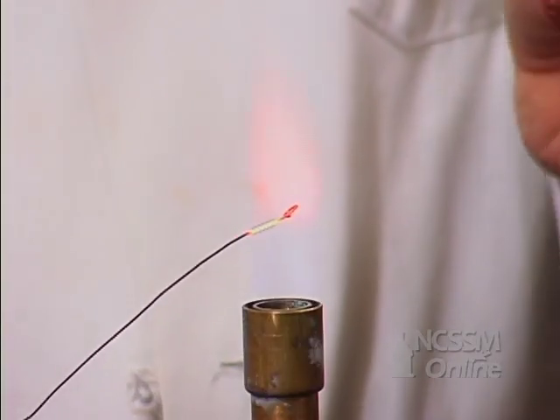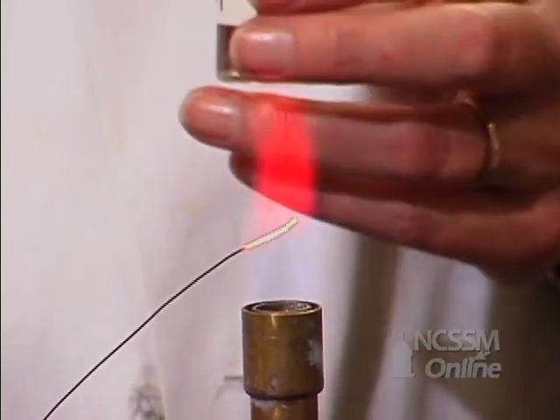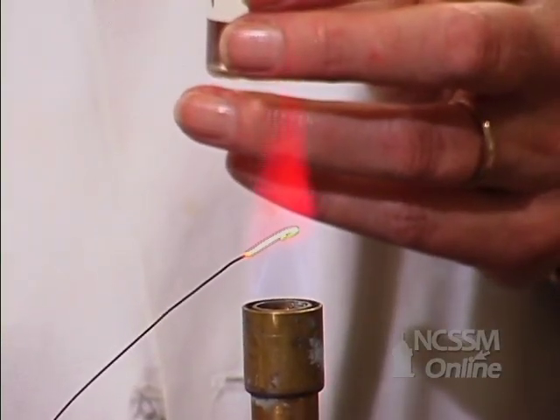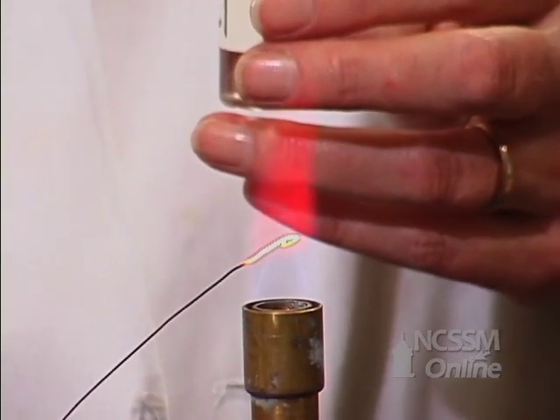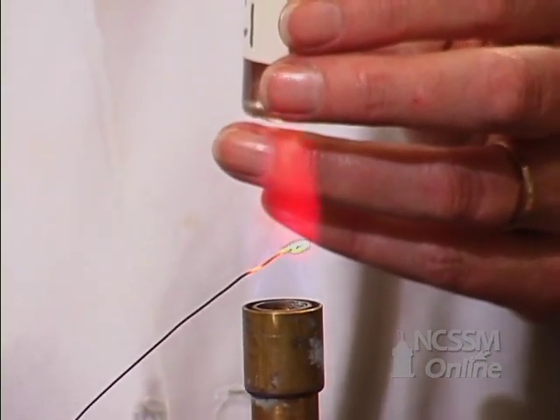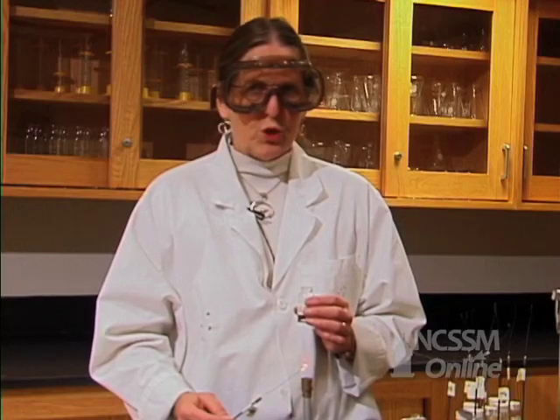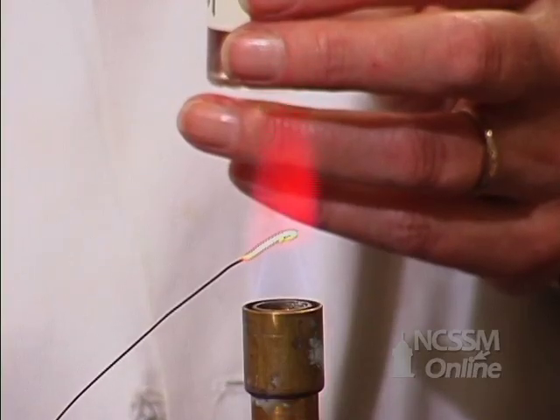So if we take lithium chloride, for example, and put it in the flame, we get a very characteristic pinkish-red color. I want you to jot down what that color looks like to you.